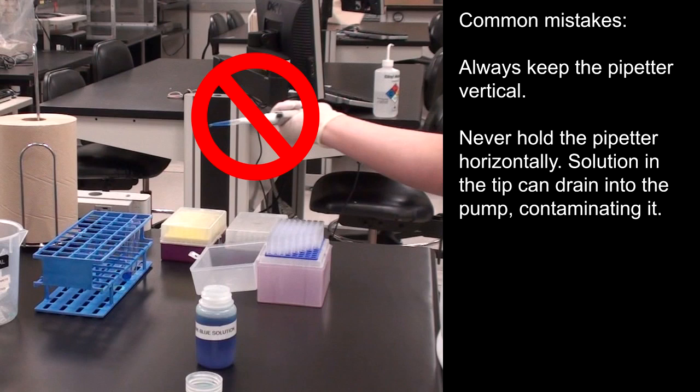Always keep the pipetter vertical. Never hold the pipetter horizontally. Solution in the tip can drain into the pump, contaminating it.